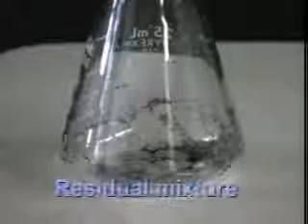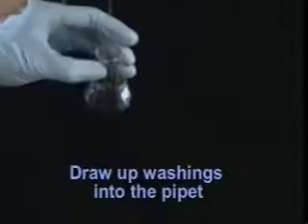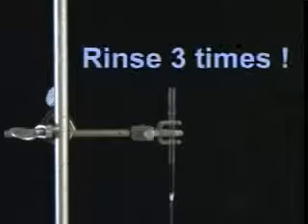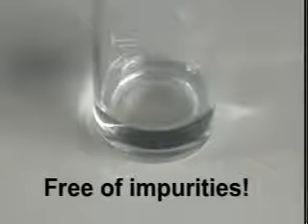Let's get back on track and take care of rinsing. As you can see here, there's residual mixture left in the flask. Rinse the flask with solvent, allowing it to run down the sides and collect any residual mixture. Draw up these washings into the pipette and transfer them, adding the washings to the filter pipette, allowing them to be filtered themselves. You need to rinse the flask and add its washings a total of 3 times. When the filtration's all done, we'll have the filtered product. Here it is, the beauty, free of impurities.